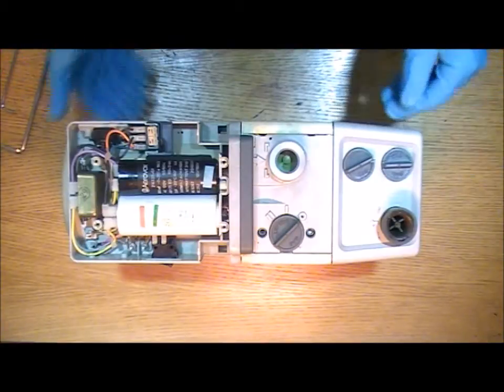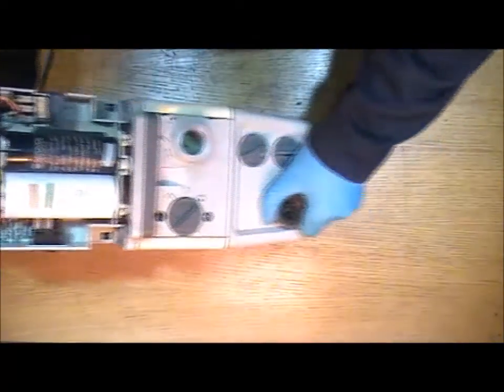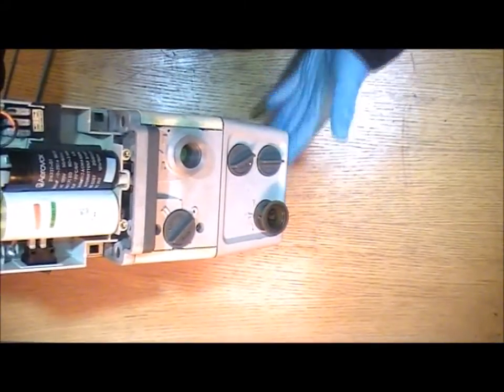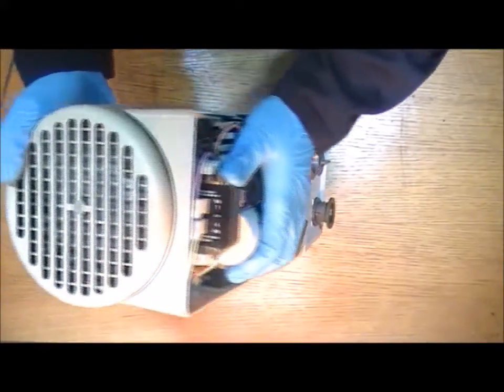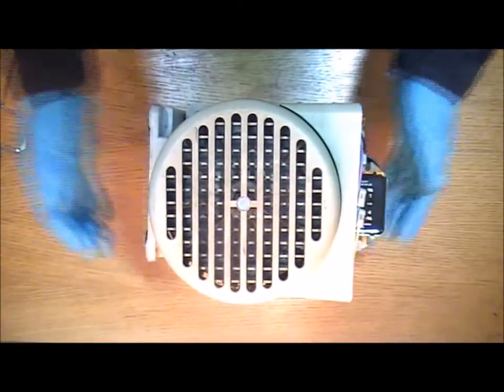Next thing to do is to tip the pump up onto its end. So the oil box down so the motor's up in the air like that.